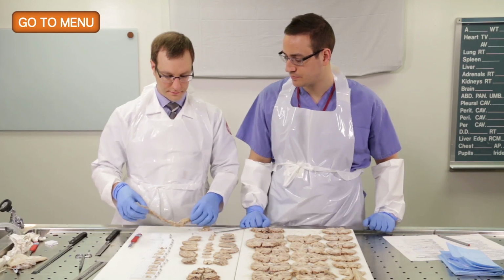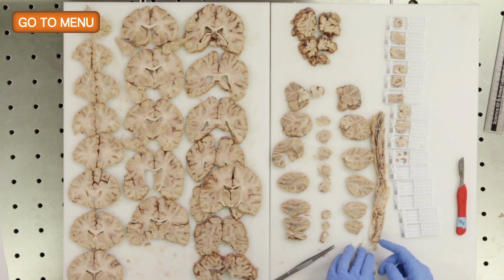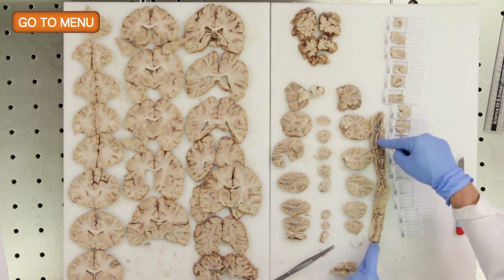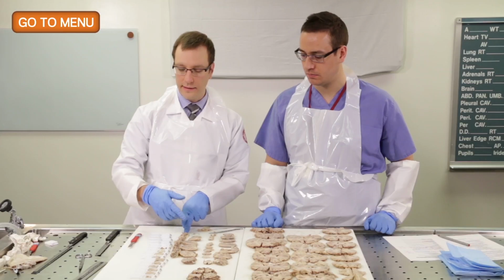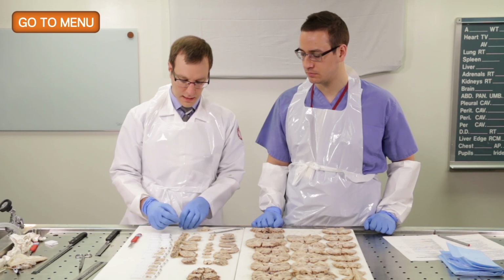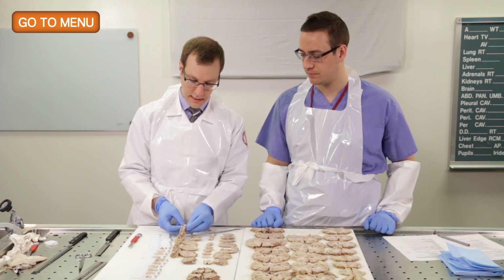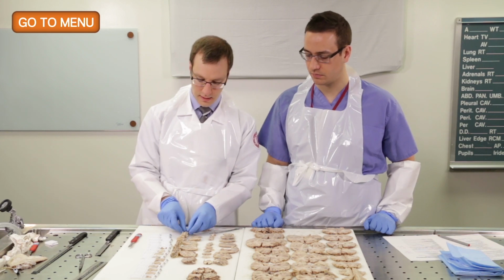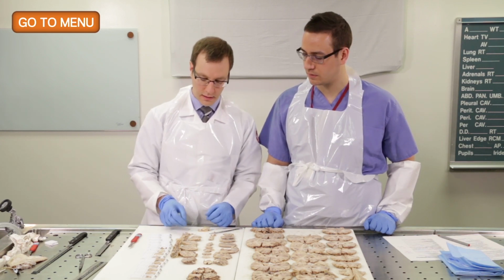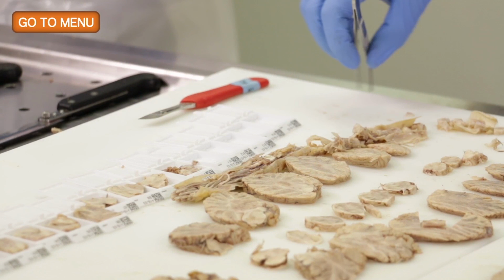For the spinal cord, we already cut the dura, but you'll use a scissor to cut the dura longitudinally, and then you'll measure the spinal cord, how much has been sampled from the most rostral aspect to the conus medullaris. In this case, it was 21 centimeters. We've already measured it, and then you'll make axial cuts down the length of the spinal cord, and then analyze to see if there's any gross lesions, which we've already done, and we don't see any gross lesions in this case. So we'll just take representative sections, and we'll choose a few sections from the thoracic aspect as well as the lumbar aspect. Okay, excellent.